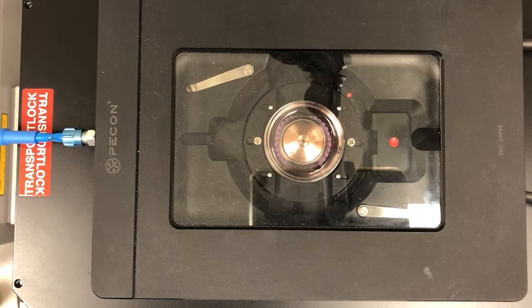and then raise the objective by turning the focus knob away from me. And hopefully you'll see when the oil touches the sample. There we go. So if I move away from me, the oil slick gets bigger. If I move towards me, the oil slick gets smaller. So this is ready to go. So the next steps are things that we need to do in the software.